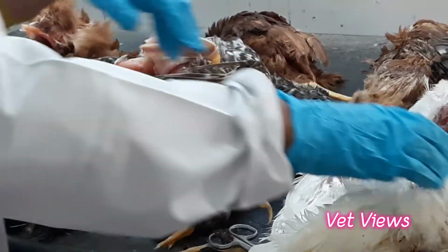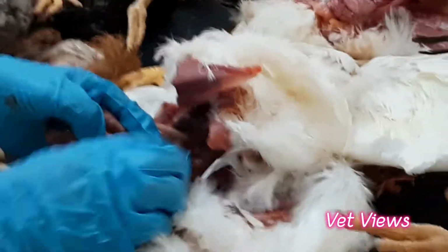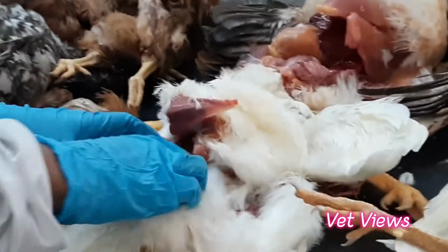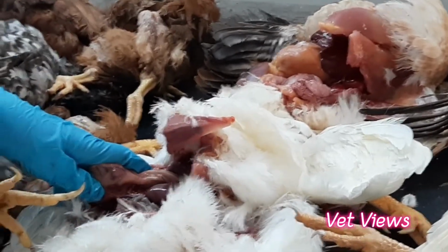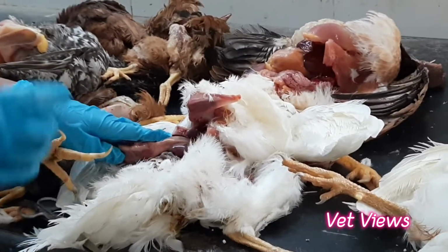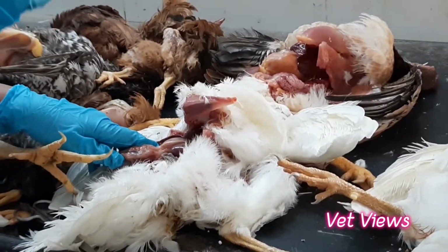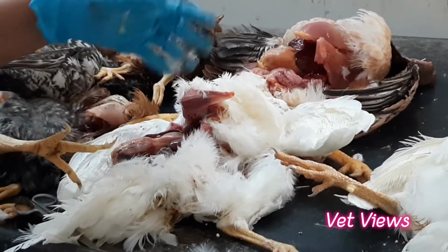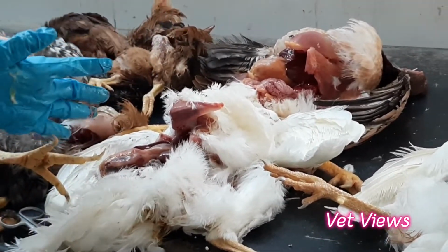Sometimes if you see the spleen, this is the spleen organ. So it is too big. It is enlarged than the normal size. So when you have the lesion in the liver as well as spleen, you have to examine the kidneys also. So sometimes you will have the tumor lesions in almost all the organs because the transformed T lymphocytes will be there in the liver, forming the discrete foci, and then spleen also will show the lesions and the kidneys also. Sometimes, very rarely, we will get them in other organs.